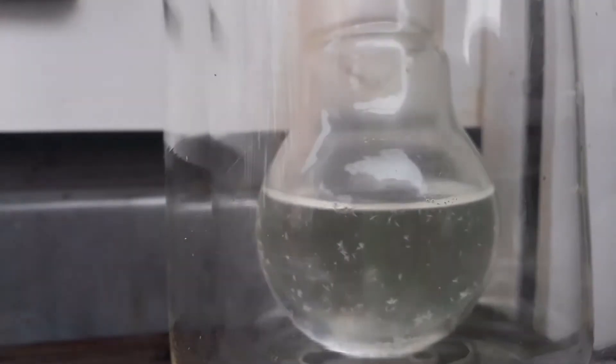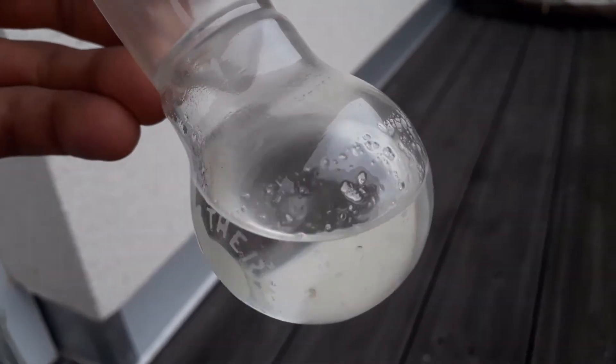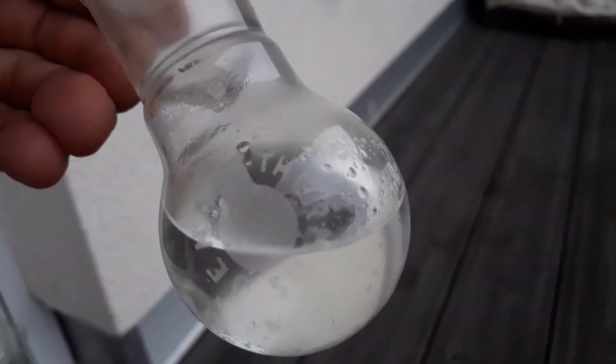Here we are one week later. You can see that a reasonable amount of crystals have formed on the side of the flask, and this is perfect to begin recovery.